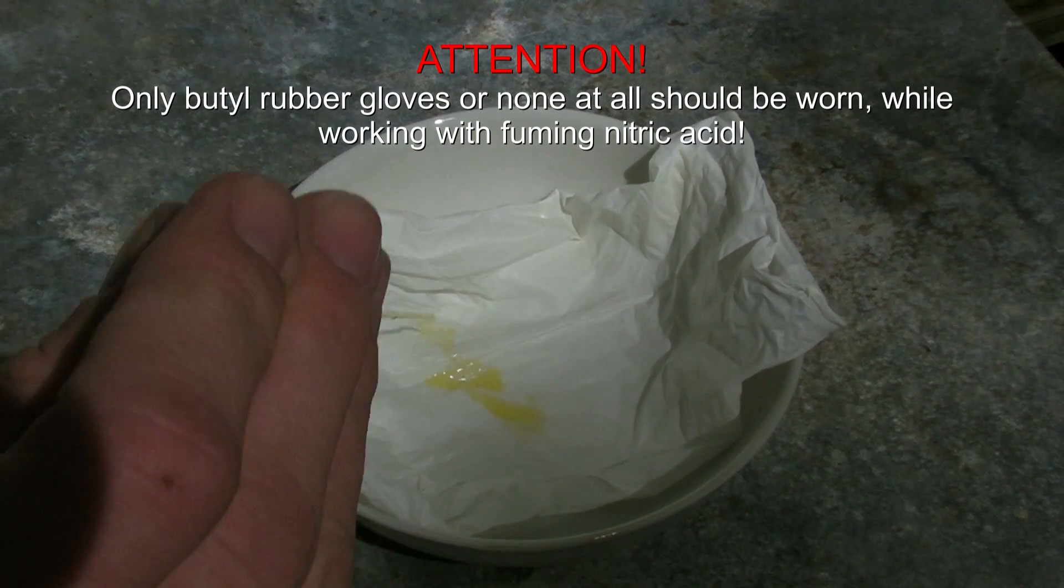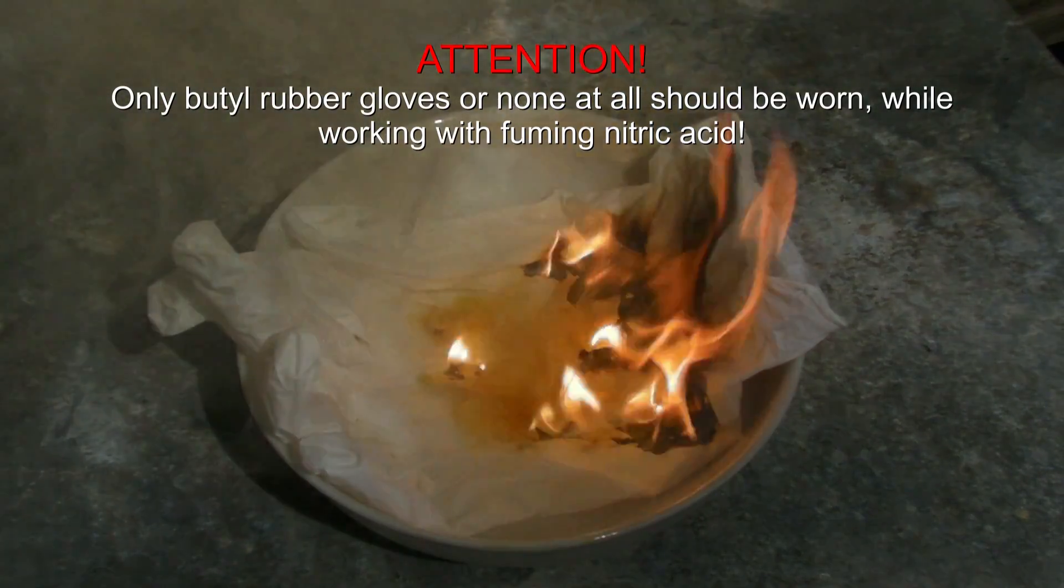Only butyl rubber gloves or none at all should be worn while working with fuming nitric acid.